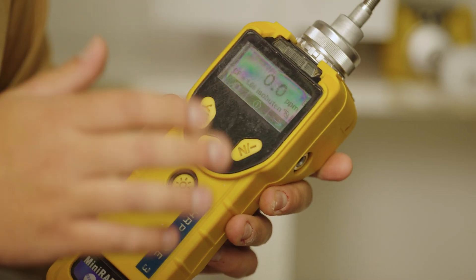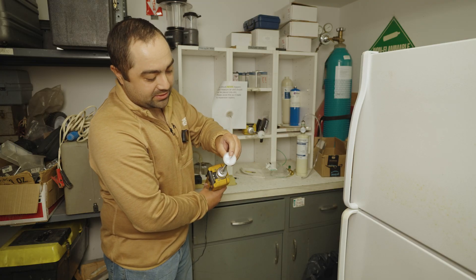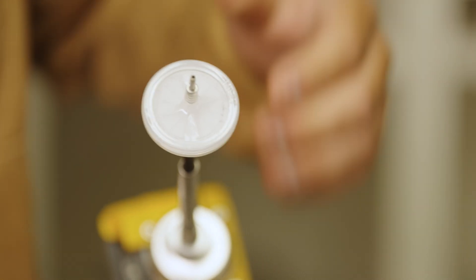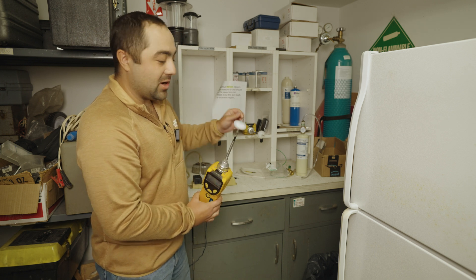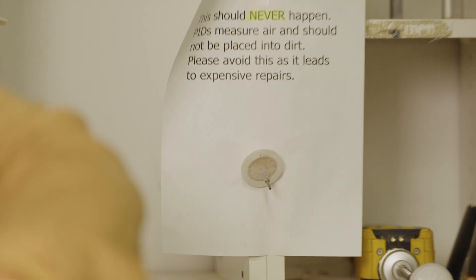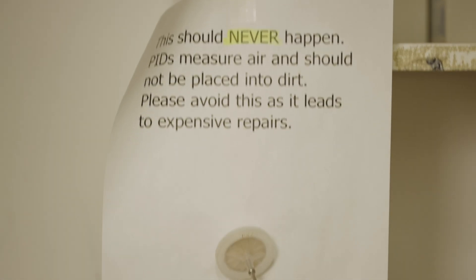The filters right here are for moisture and they can get clogged sometimes when sucking up particles while taking readings out of dust bags or jars. You don't want your filter to end up looking very dirty — you want it to look clean and fresh. These filters should be supplied with your PID and you should always have some backups in the field just in case.